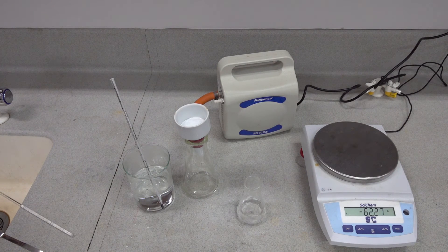It probably needs to cool down as well. With slow crystallisation we're expecting to form larger crystals, and that's the object of the exercise.